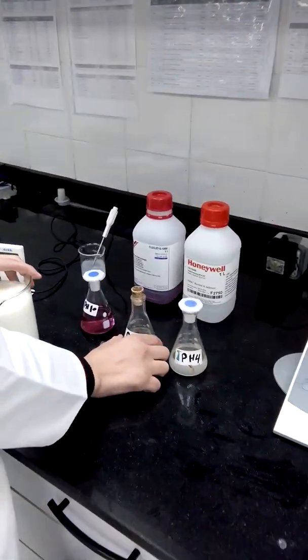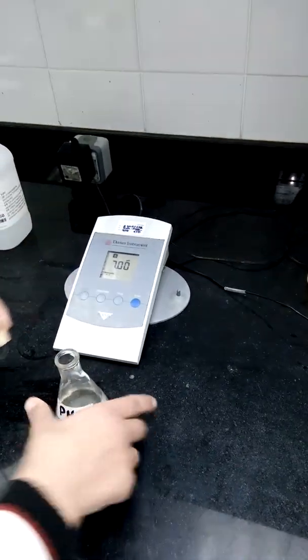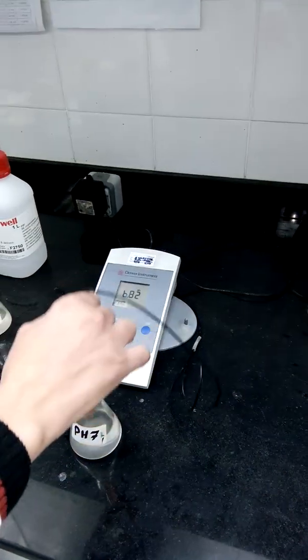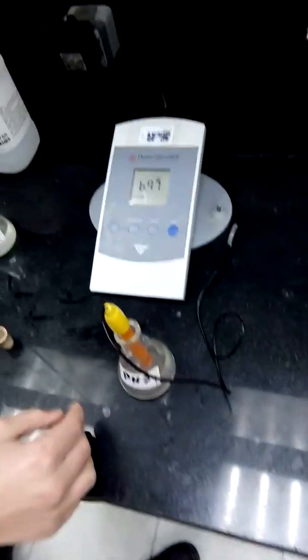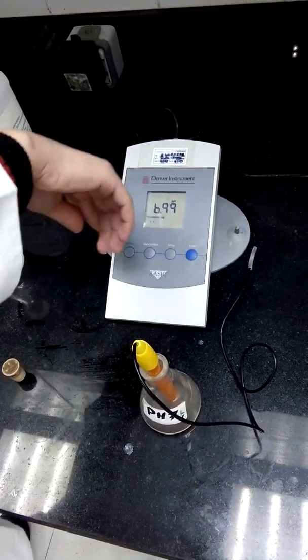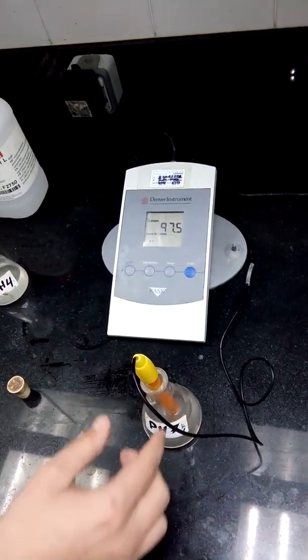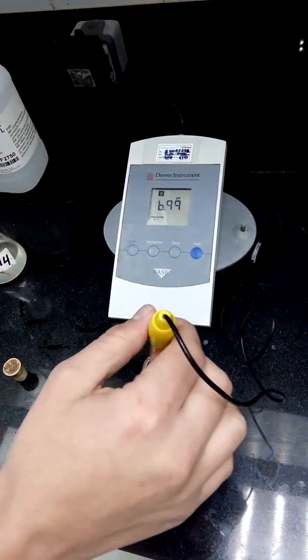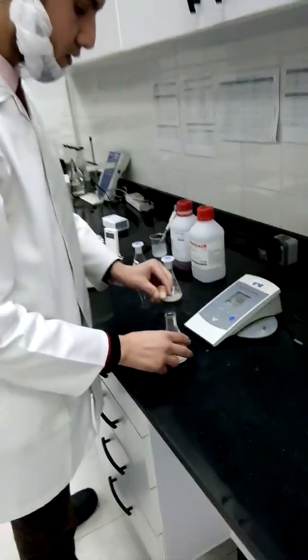We have to use pH 7 buffer because the pH for milk is acidic but close to neutral. I have to perform my validation to make sure that our pH meter is ready for use. Now the pH meter is ready for use.